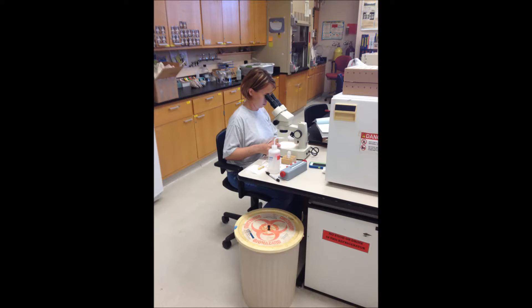Again, three to five days is best, after which you can view your sample using a dissecting or stereo microscope to identify the microarthropods that you collected.